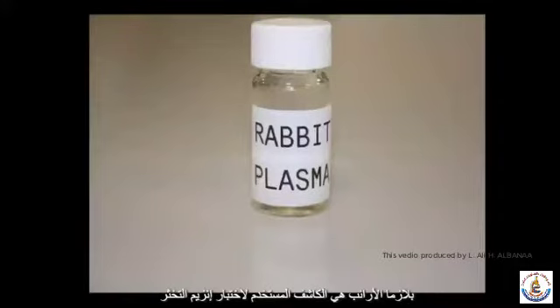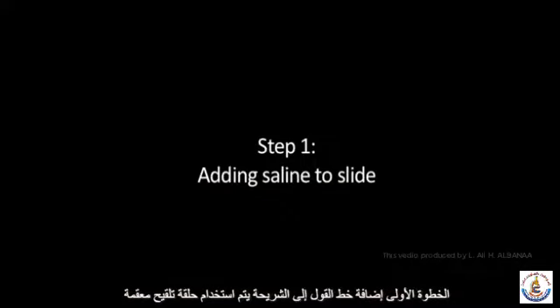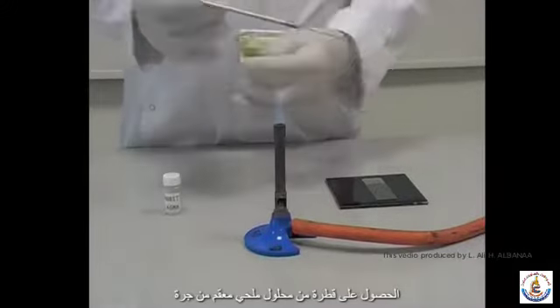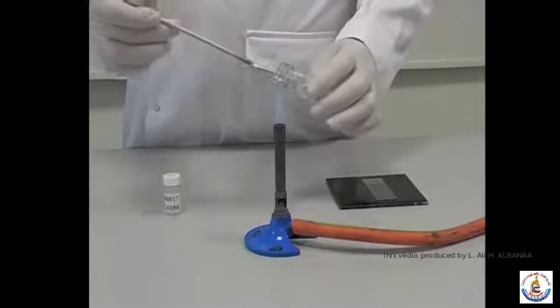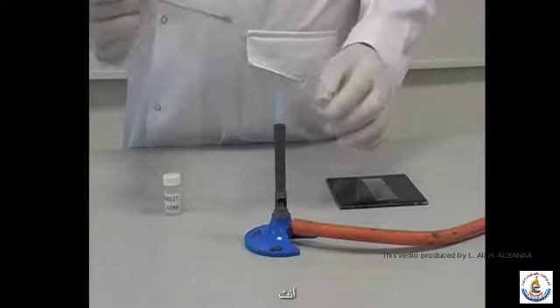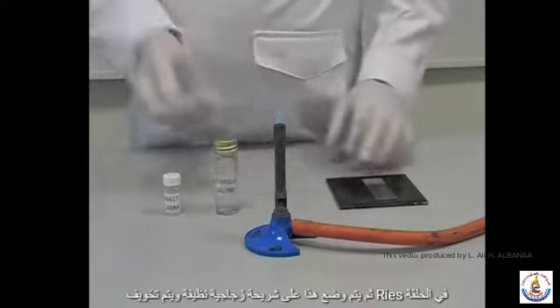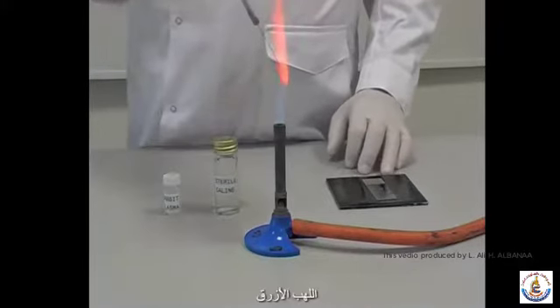Coagulase test. Rabbit plasma is the reagent used to test for the coagulase enzyme. Step 1. Adding saline to the slide. A sterile inoculating loop is used to obtain a drop of sterile saline from a jar. This is then placed on a clean glass slide and the loop is re-sterilised in the blue flame.